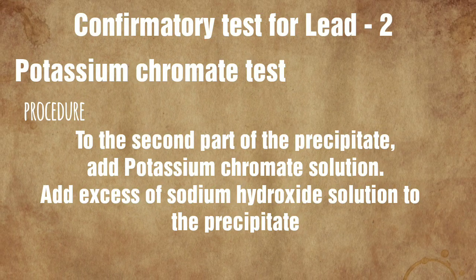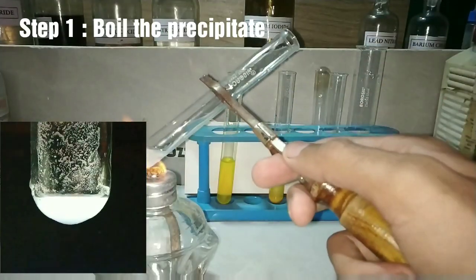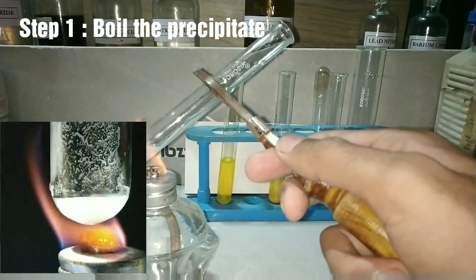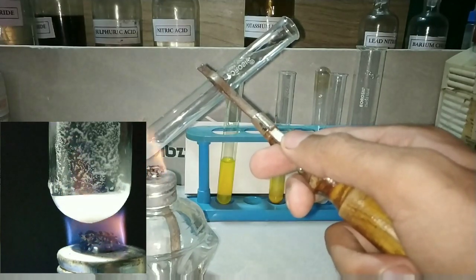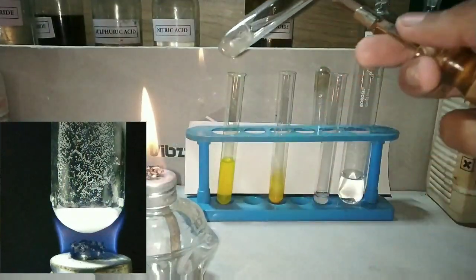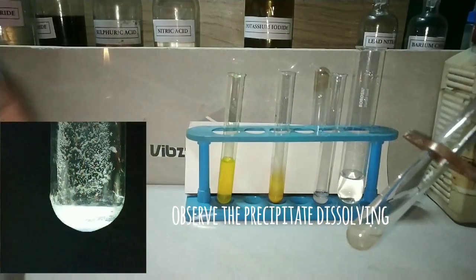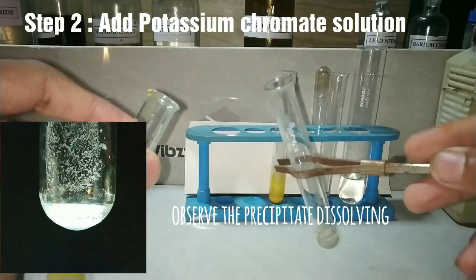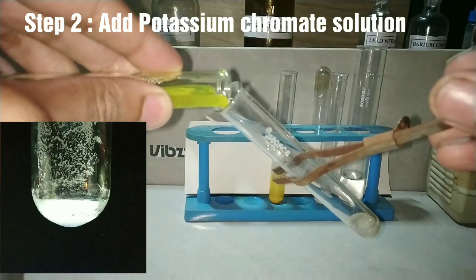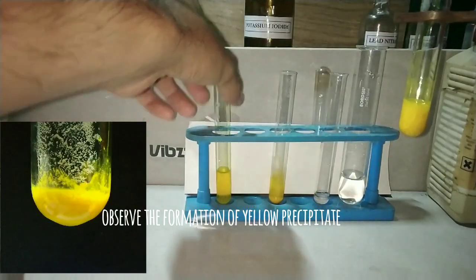The potassium chromate test involves boiling the second part of the precipitate and adding potassium chromate solution. On boiling, the lead chloride which was formed will dissolve in hot solution and we get a clear solution. We then add potassium chromate solution — it has a yellow color but is a clear solution. On adding potassium chromate into the dissolved precipitate solution, you get a bright yellow precipitate.